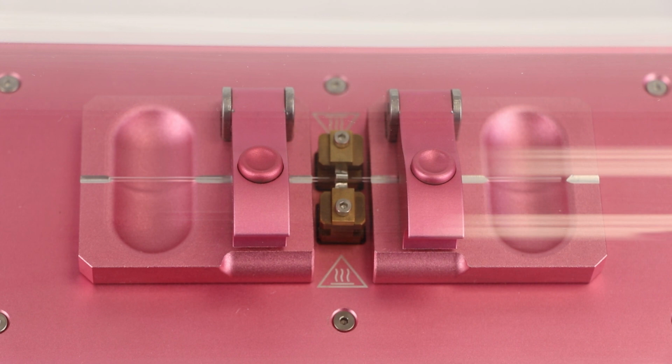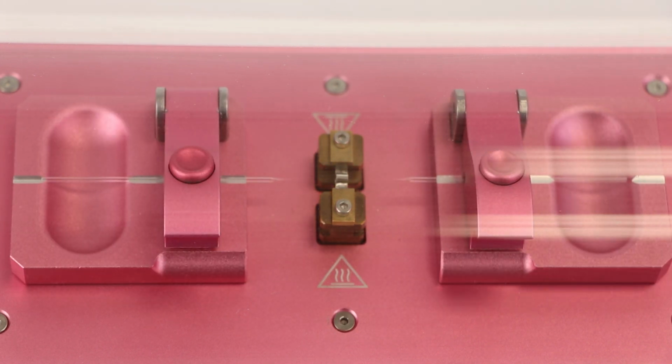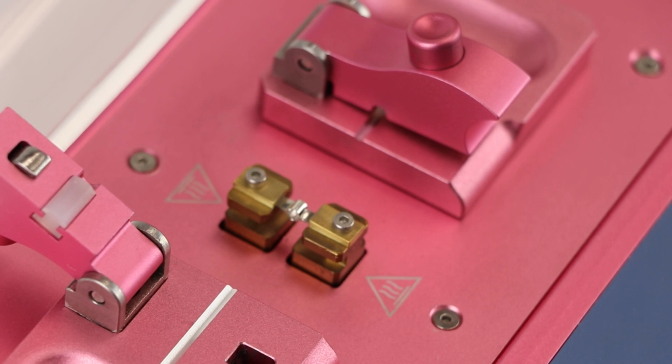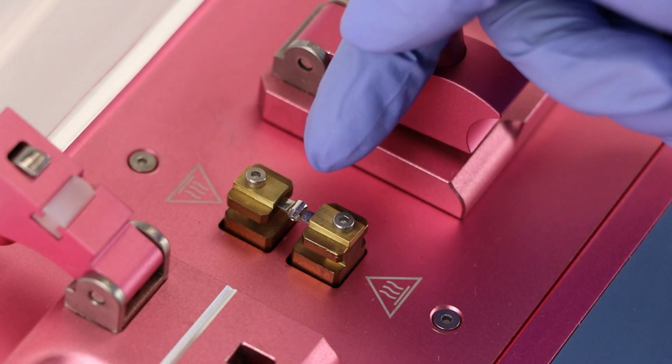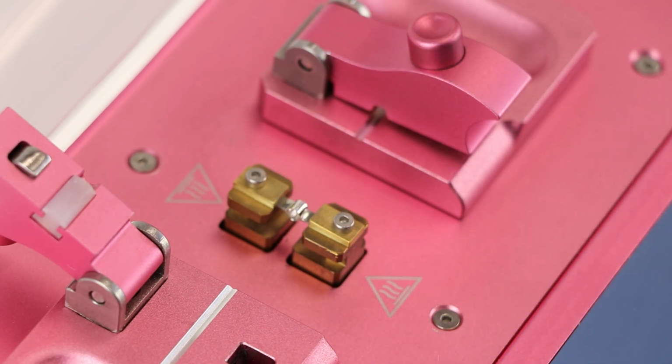As the temperature of glass increases, the glass transitions gradually from a hard and relatively brittle solid state into a soft and viscous state. To form glass into certain shapes using a puller, heat is applied through a filament, and many factors affect how the heat is transferred from a filament to the glass capillary.